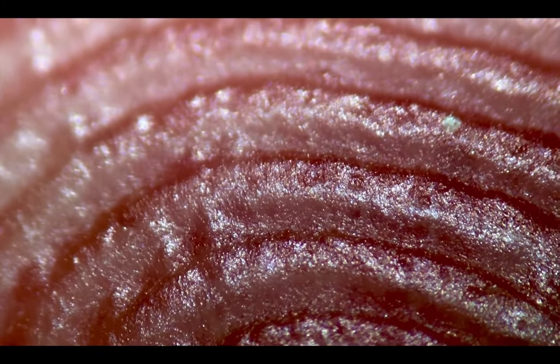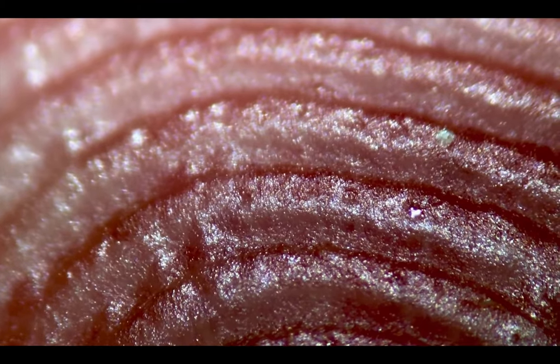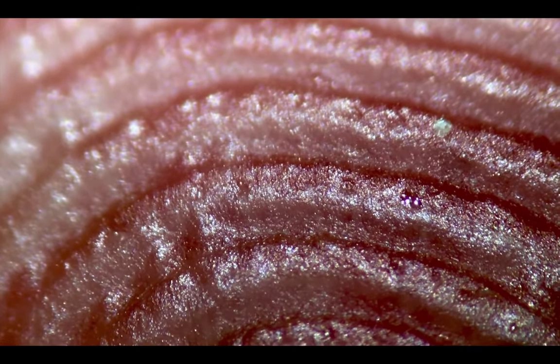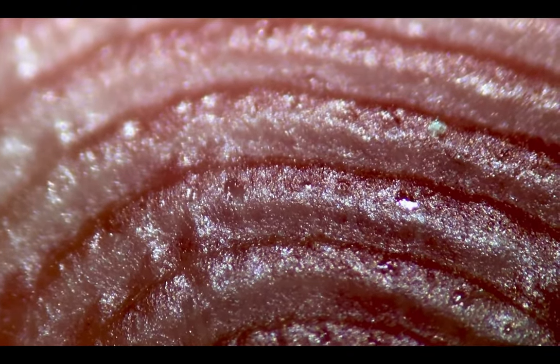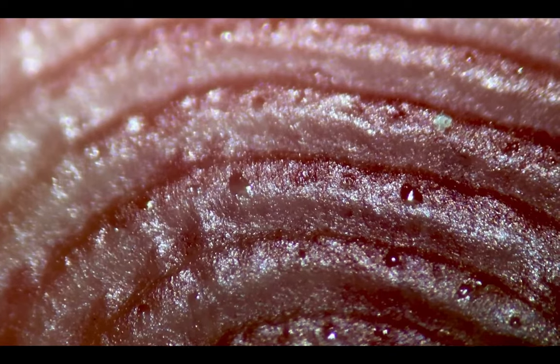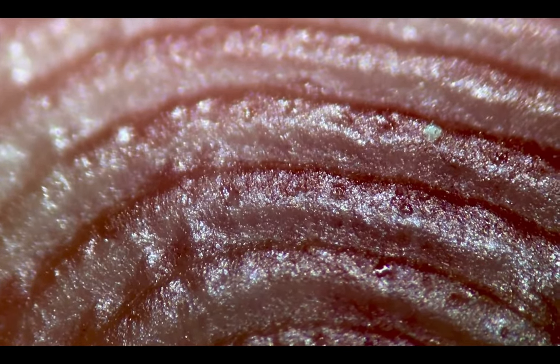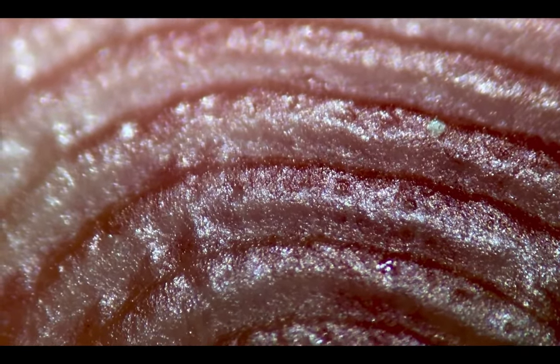As students, we're always introduced to the microscope. Well, you can't really stick your finger under the microscope. So with dissecting scopes, you can put any kind of object under the scope, and so you can easily put your hand under there, and you can see the sweat glands secreting sweat and reaching the surface through the sweat pores.